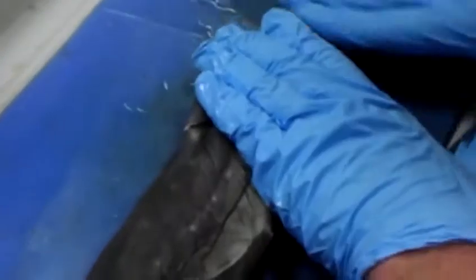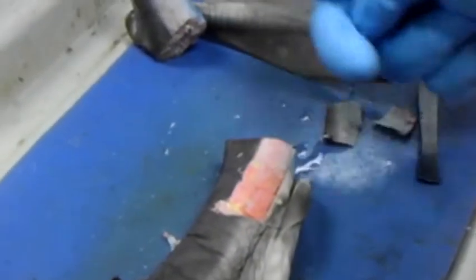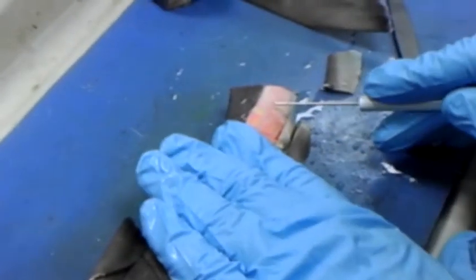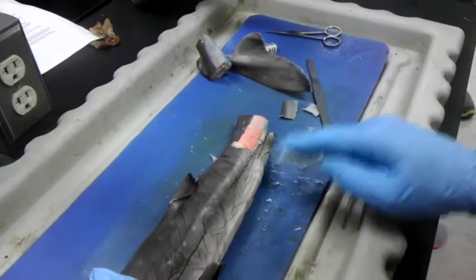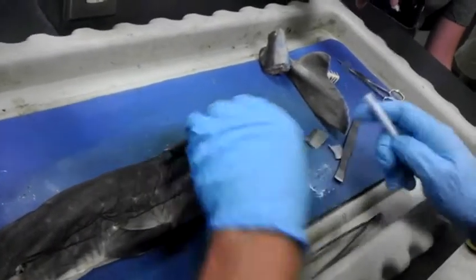All right. Another way that we can think about the muscles is that the muscles show examples of segmentation. So hypaxial, epaxial, red muscle, white muscle, it's still all in there. But another way we can look at the muscles is in these segments. You see these different segments, and if we continue on through here, it's this W that runs up the fish, essentially. They're in segments, an example of metamerism.